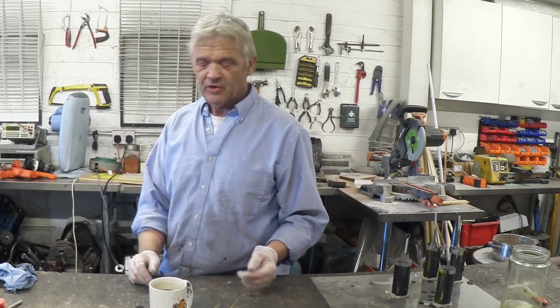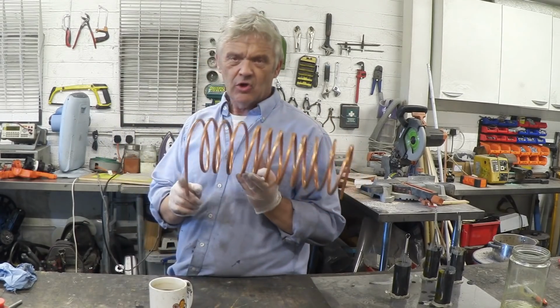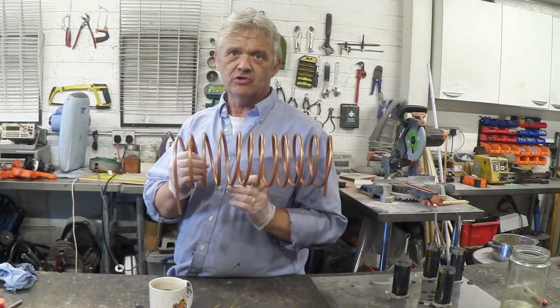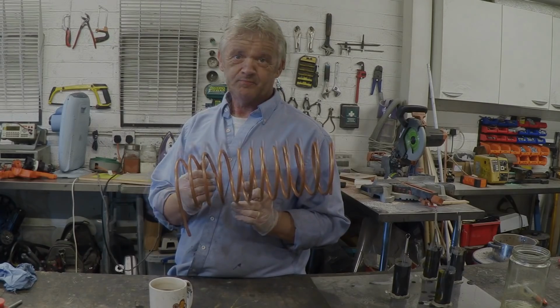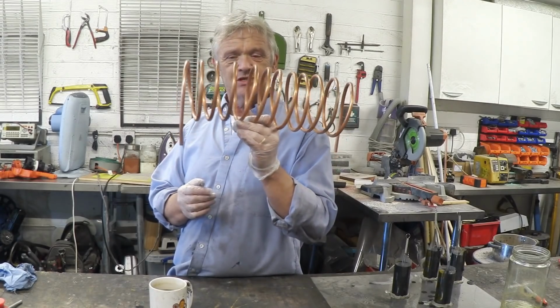Now, we can make this equipment really, really easily. The core of it is that coil. It's got an envelope around it because we have water cool it, but the coil, if long enough and made of a material that can get rid of that heat, doesn't have to have a jacket around it. It can just be exposed to the air. Of course, this material is awesome for that. It's copper. So I've got here a bit of 8mm microbore pipe. Microbore is meant for taking turns and radiuses, and you can bend this stuff super easily by hand. Once we bend this around a former, that is the core of our distillation equipment. That's what we actually need.